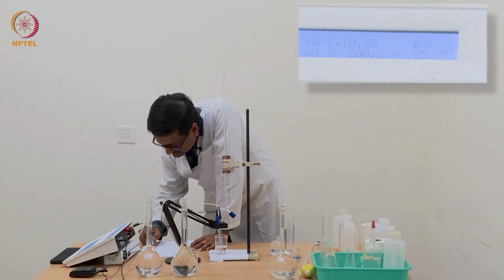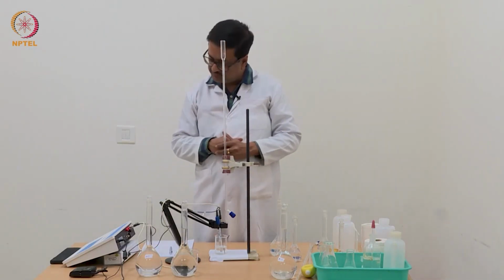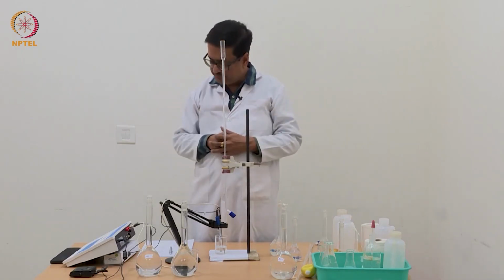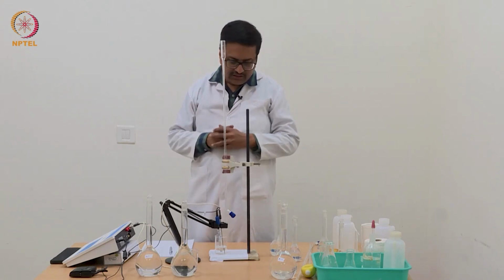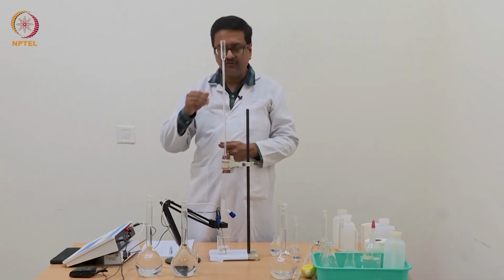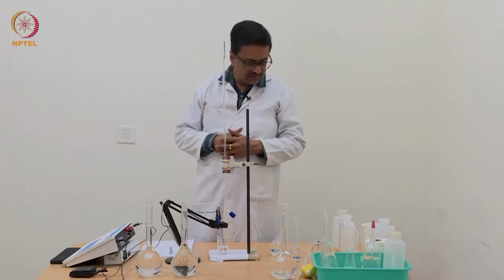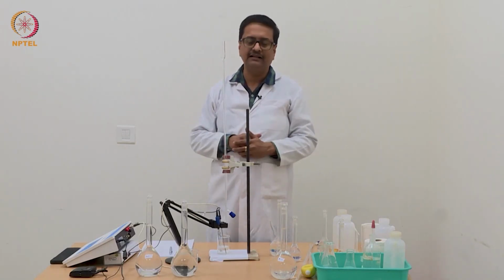So what we see is the increase towards the end has now again reduced back to a difference of 0.05 or 0.06 in pH, and that is where one should stop this titration and use this entire data to plot the volume of NaOH versus pH, and also delta pH versus volume of NaOH, and see how the S type of curve comes for three different acids.